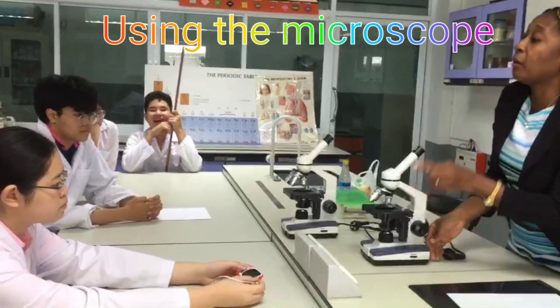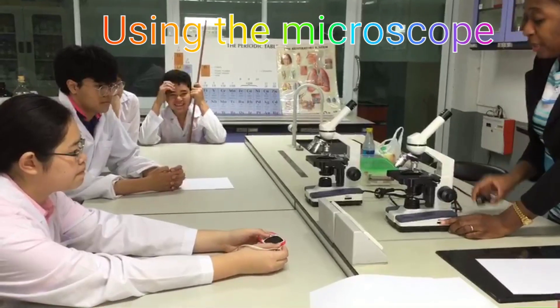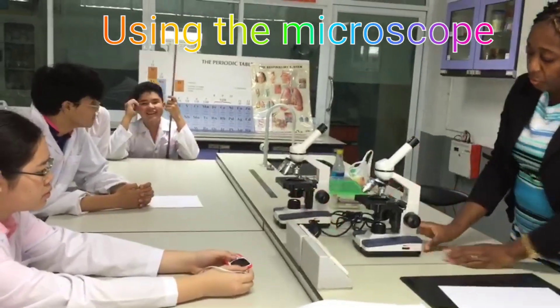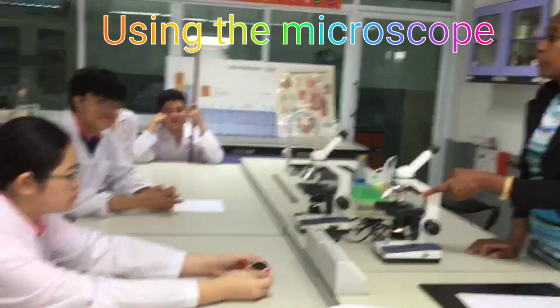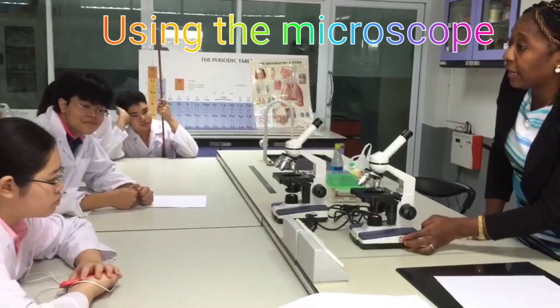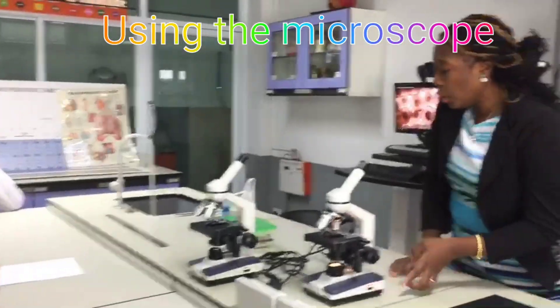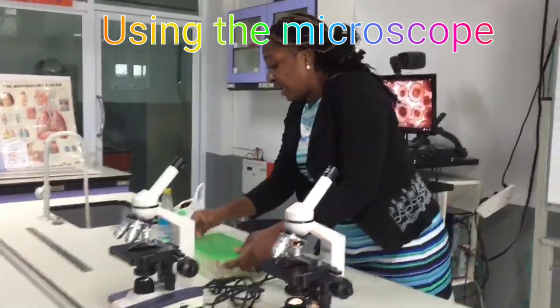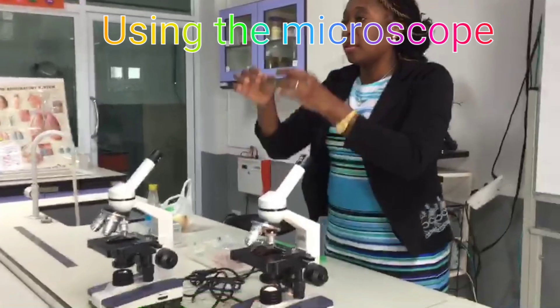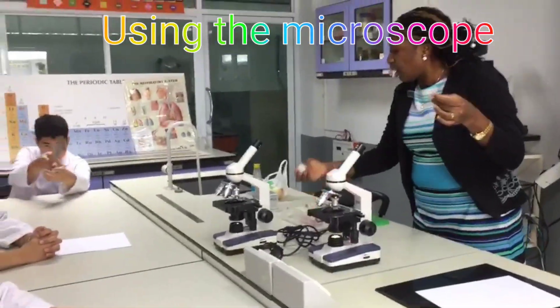You cannot view a specimen without turning on the light. So when you plug in your microscope and you turn it on, you are going to see the light source. You can regulate your light — increase or decrease depending on what you want to view. These are a sample of the slides that you are going to use. This is a microscope slide, and these are cover slips.